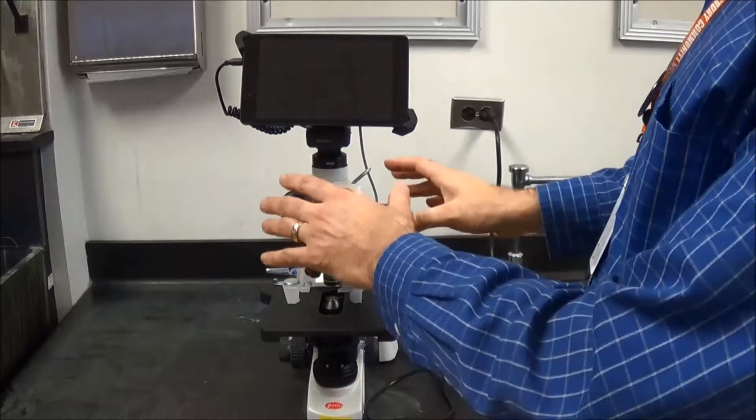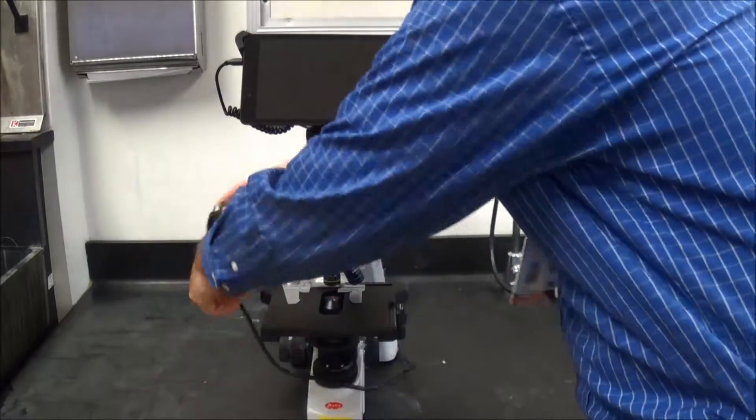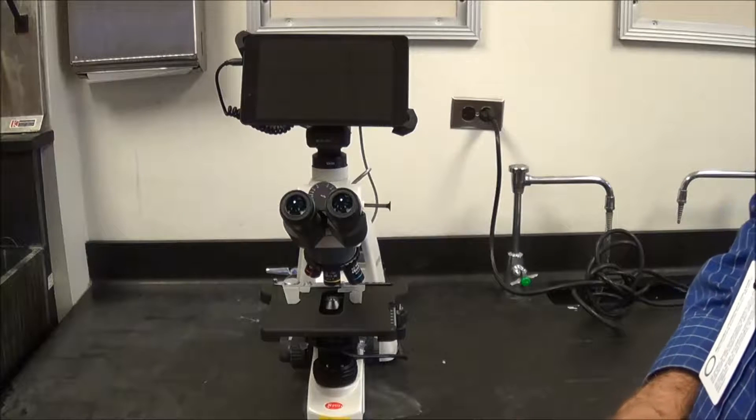This will keep the microscope in better shape over the long run. Have them wrap up the cord and put the microscope back where they found it.